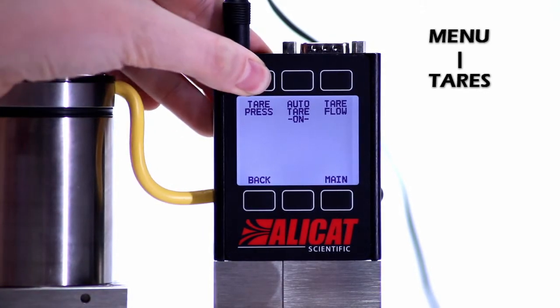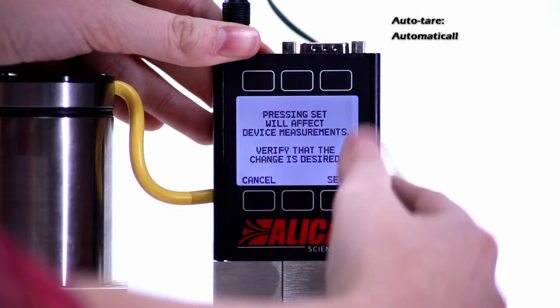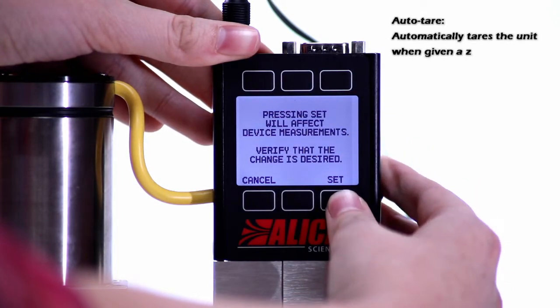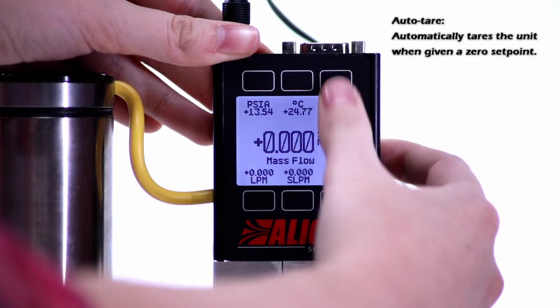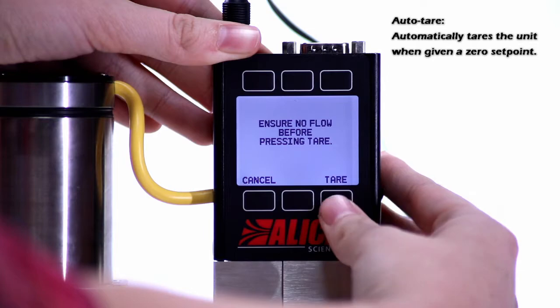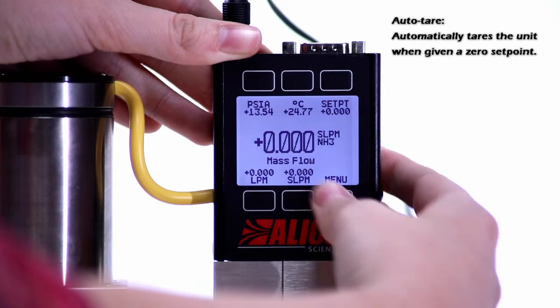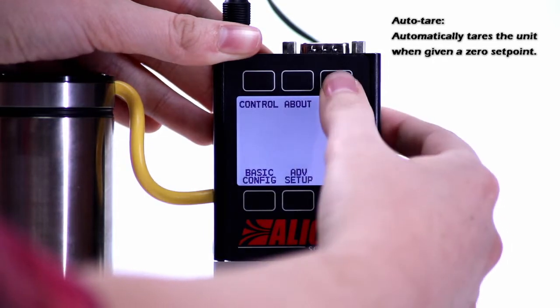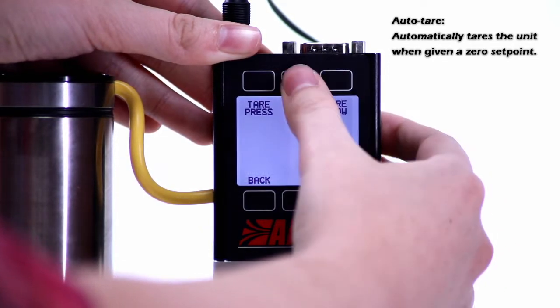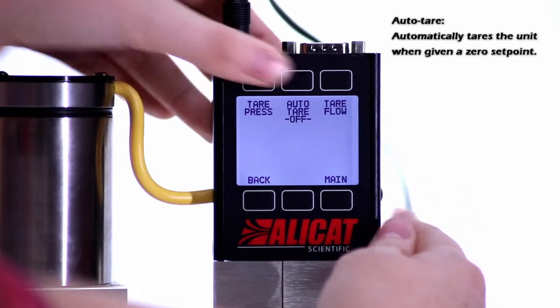You can click any one of these to tare the pressure, tare the flow, or turn auto tare on and off.